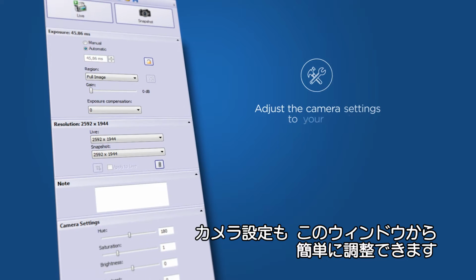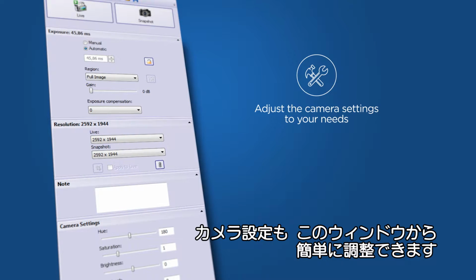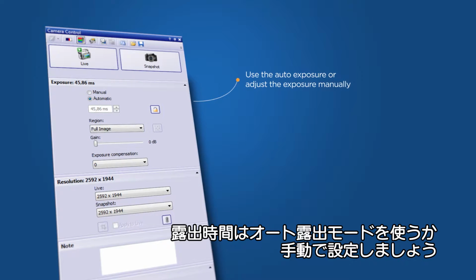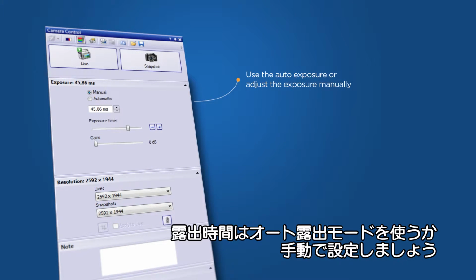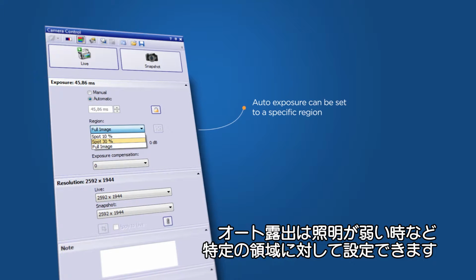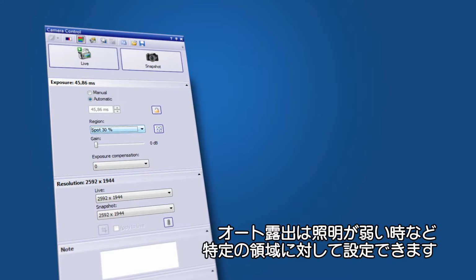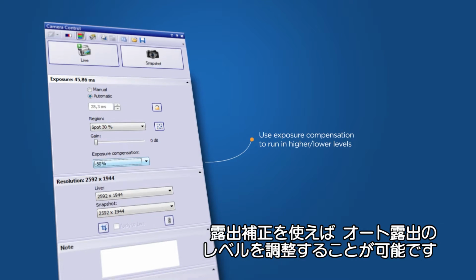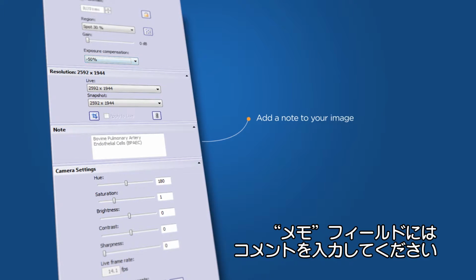Furthermore, this is the place to easily adjust the camera settings to your needs. For example, use the auto exposure function or adjust the exposure manually. The auto exposure can be set to a specific region, such as when working in critical light situations. The exposure compensation allows the auto exposure to run in higher or lower levels. Use this text field to save important metadata for your image.